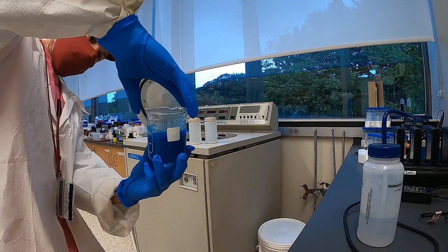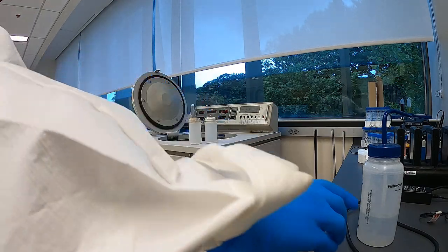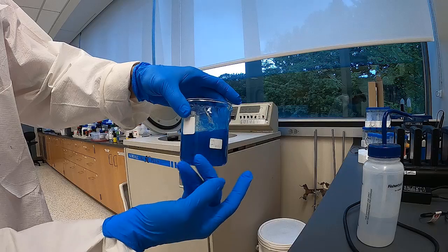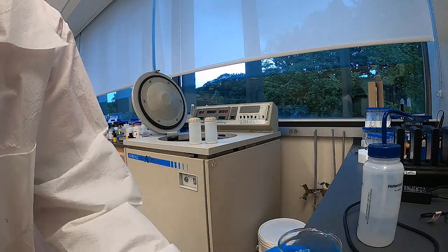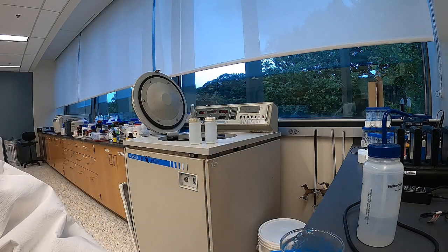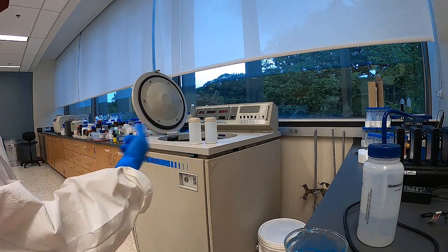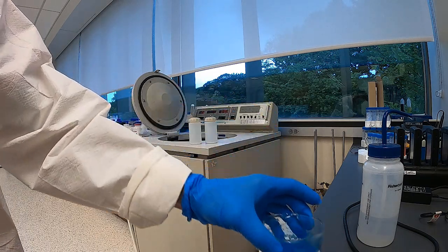So it's Mr. Davis back here again, and as you can see, it didn't really settle out. So there's a few options we've got. We could do a number of things to isolate the precipitate, which is the copper hydroxide. You could filter it. Decanting obviously doesn't work, but what I'm going to try, and I think will work probably best, is to centrifuge it. That's basically like a washing machine spinner, and it's going to use centrifugal force to pull the solids down.